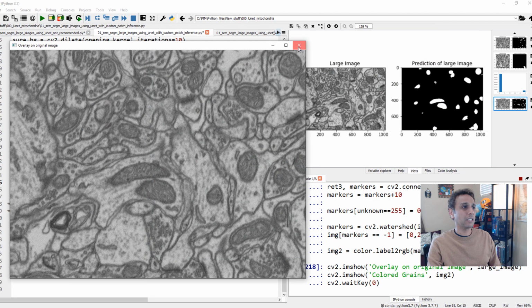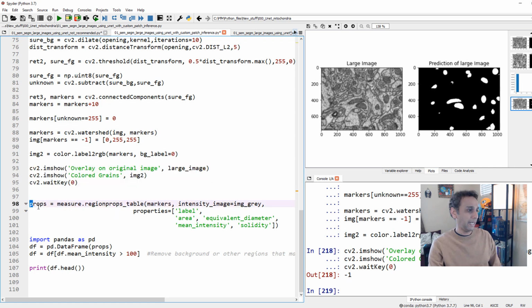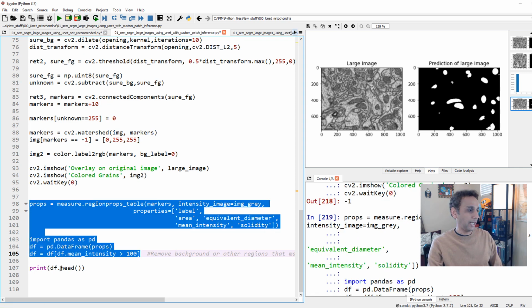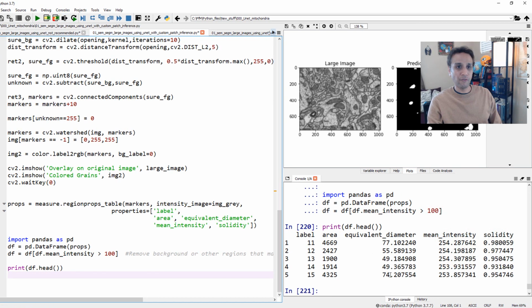And once this is done, let's go ahead and calculate our object properties. Again, I'm using measure.regionprops_table. And once you measure those, and remove the very large or very small regions if you want, then go ahead and print out what we get. So this is 1, 2, 3, 4, 5 mitochondria here, and each mitochondria with average equivalent diameter. You can report more. I'm just reporting 1, 2, 3, 4 of these, but you can report many parameters. Look at the documentation for regionprops.